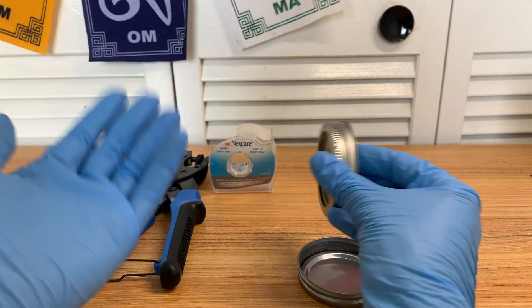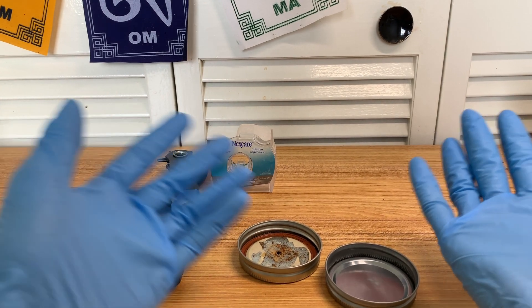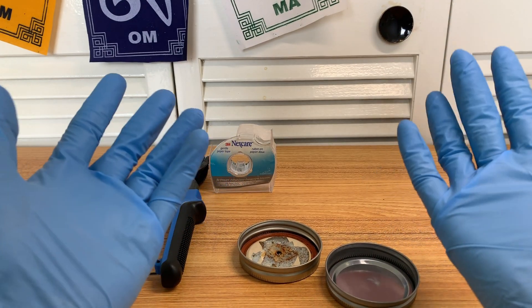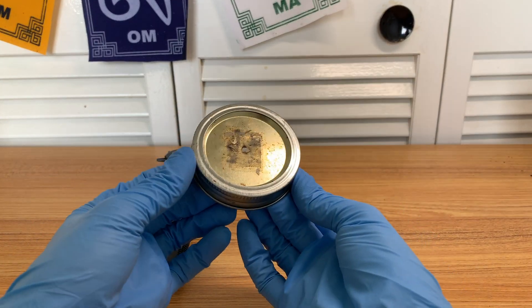That jar also showed that grain jars, as long as you sterilize them properly, can last a long time. They're not going to contaminate after two weeks as a lot of people used to say. People say you've got to inoculate as soon as your grains are ready, but if you sterilize properly and your grains are clean, you shouldn't have any issues long term.